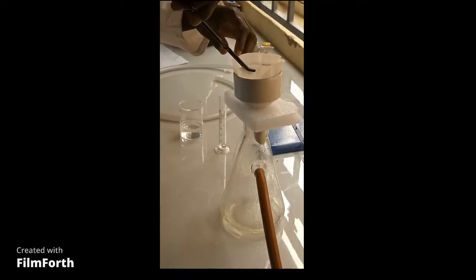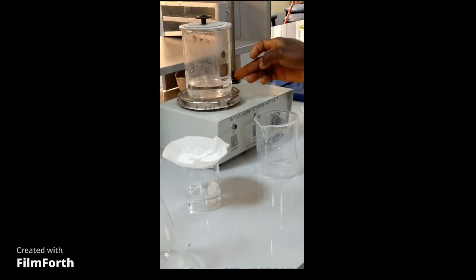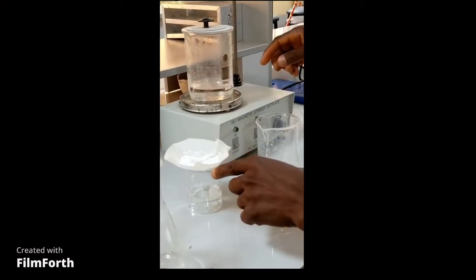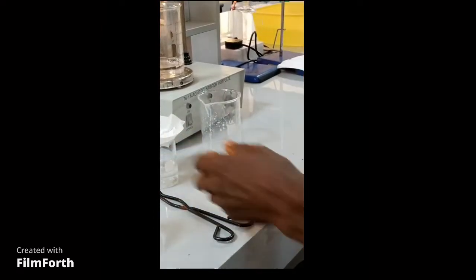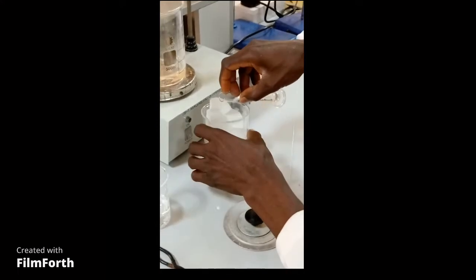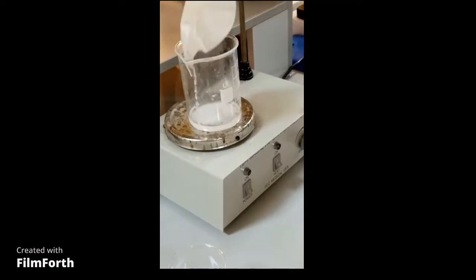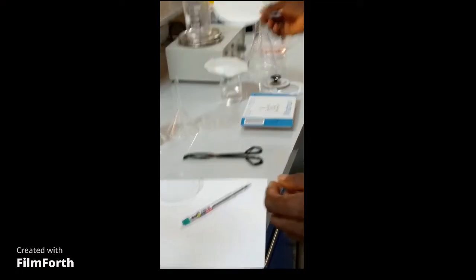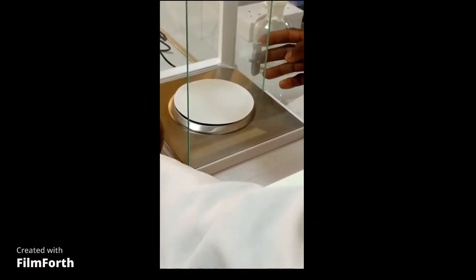The next stage is to recrystallize with a mixture of ethanol and water. This is a mixture of ethanol and water on the hot plate. We use 10 ml of this to recrystallize the product. We take 10 ml and use it to rinse the product into the beaker for the process of recrystallization.